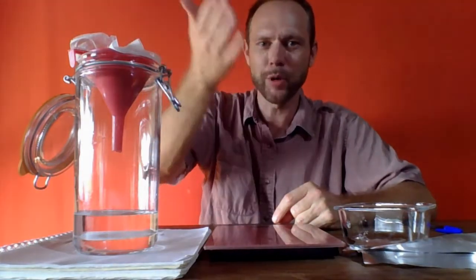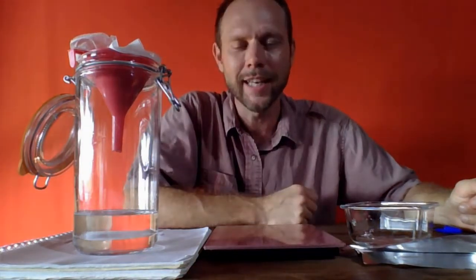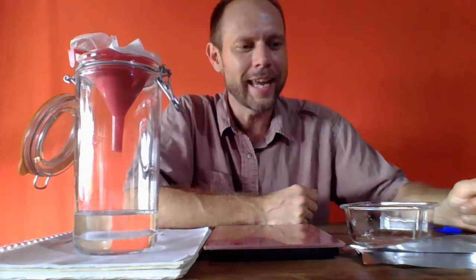So I can't just put this filter with the paper on my scale directly, one, because it's wet, two, because it's a mess and it's going to destroy the scale. So I'm going to slowly dry this in the oven in a small glass tray. We could just as easily set it outside now and let it dry in the sun. Now, the one thing we have to consider is whether the wind is going to blow some of that sand away as it dries. So I'm going to do this a little quicker in the oven.